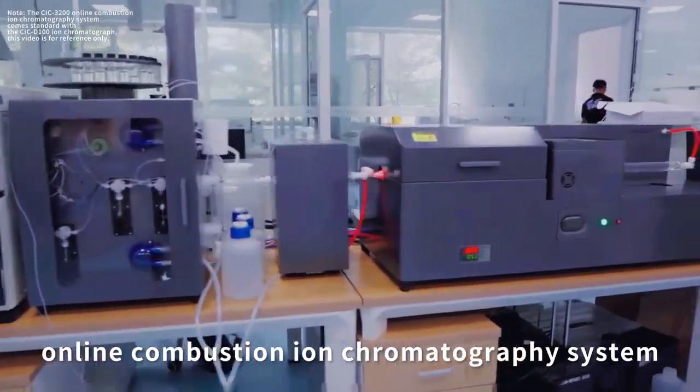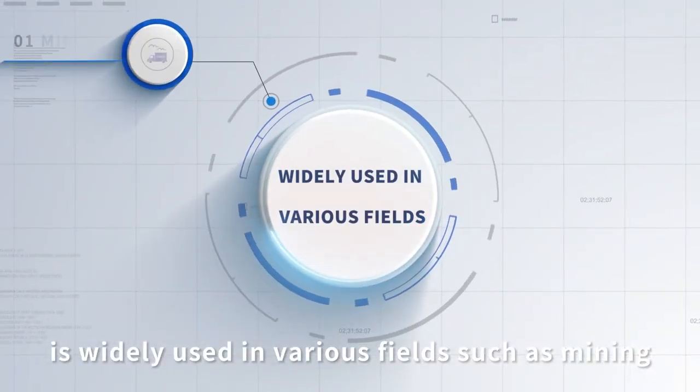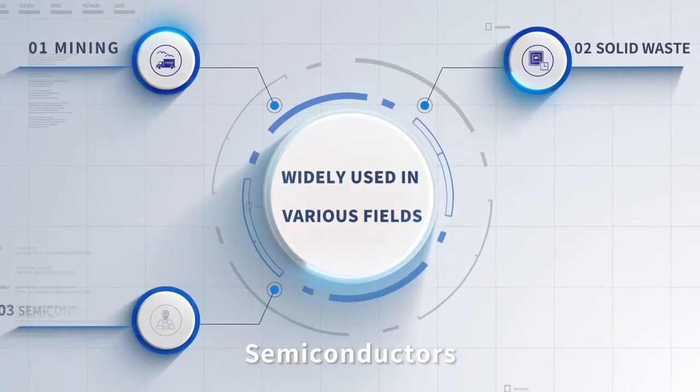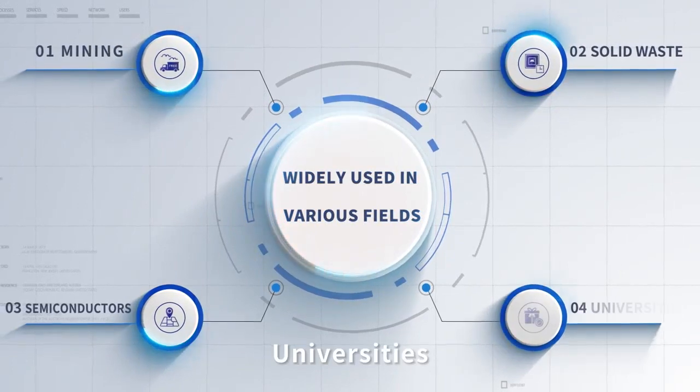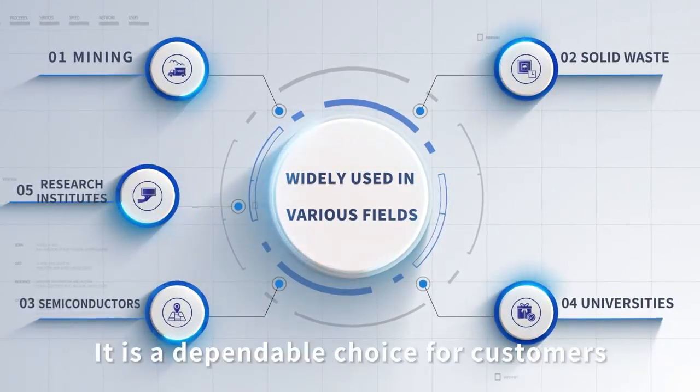SH-CIC3200 online combustion ion chromatography system is widely used in various fields such as mining, solid waste, semiconductors, universities, research institutes, etc. It is a dependable choice for customers.